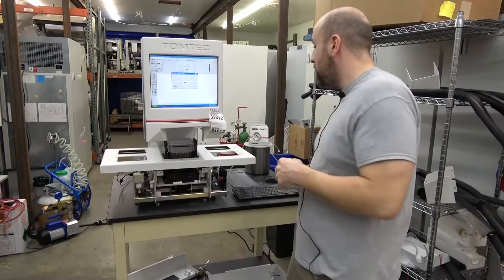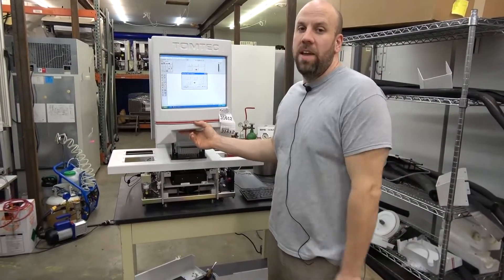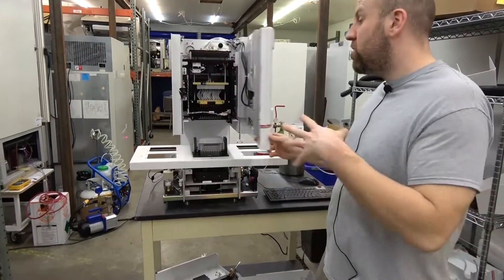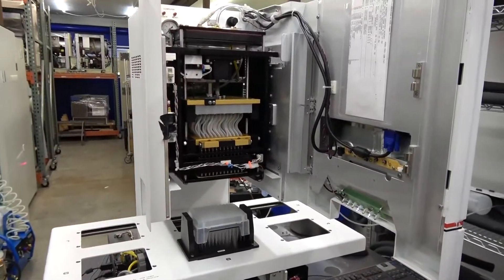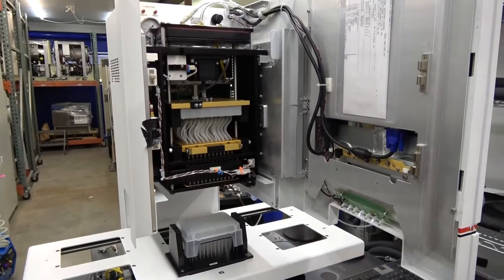This is the SPE model - it can do solid phase extraction. We're going to show you some functions, show you how the mechanisms work while the unit is going through its normal functions.